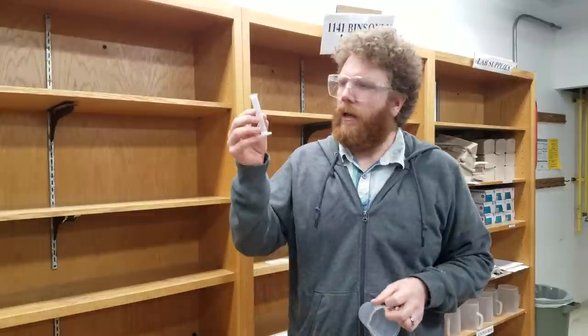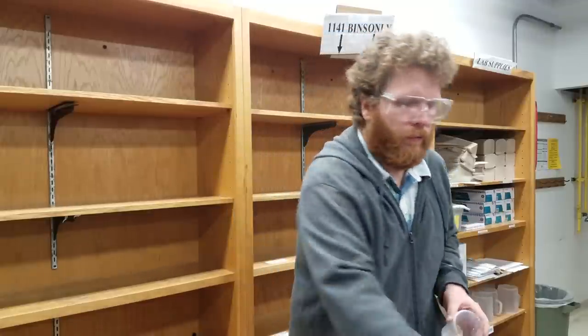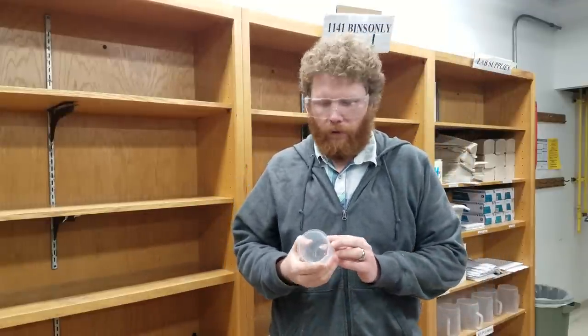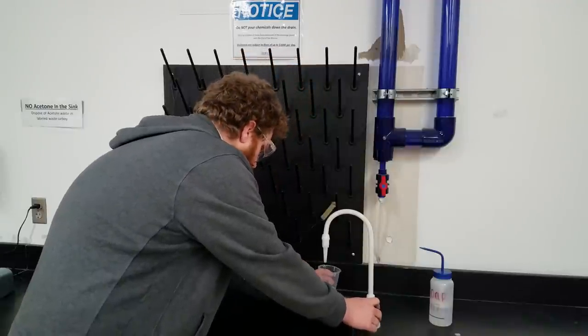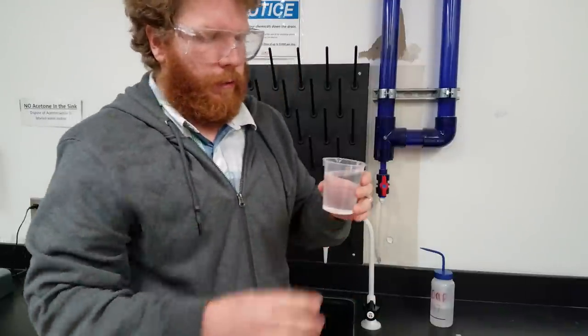For your first trial in experiment number one, the first thing you want to do is get your 10 milliliter graduated cylinder, take it to the weigh room, and determine the precise mass. Record that mass on data table number two. Next, take your 250 milliliter plastic beaker and collect approximately 200 milliliters of deionized water. The deionized water comes from the white faucet — DI stands for deionized. We only need about 200 milliliters; this is not an extremely precise measurement.